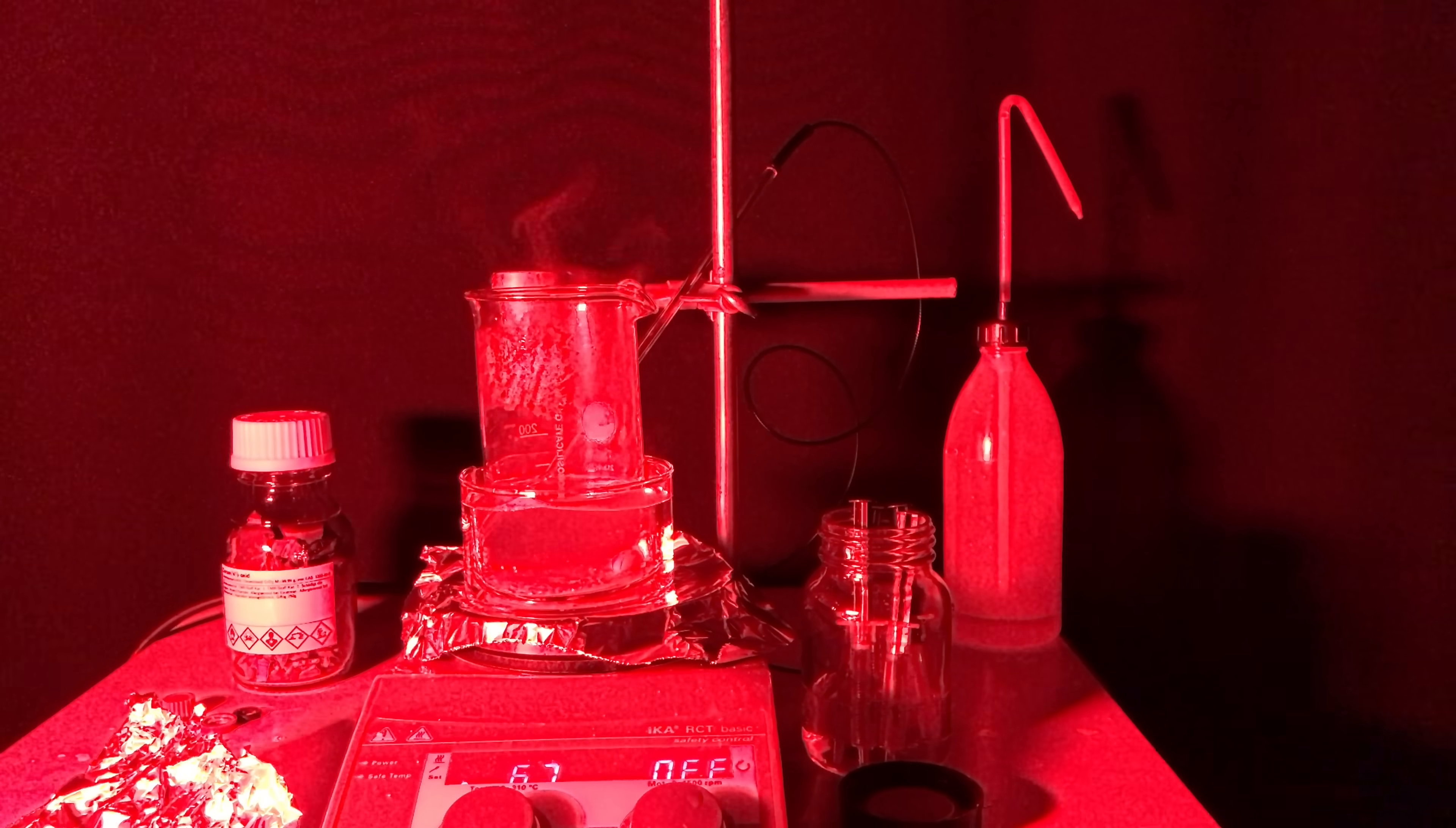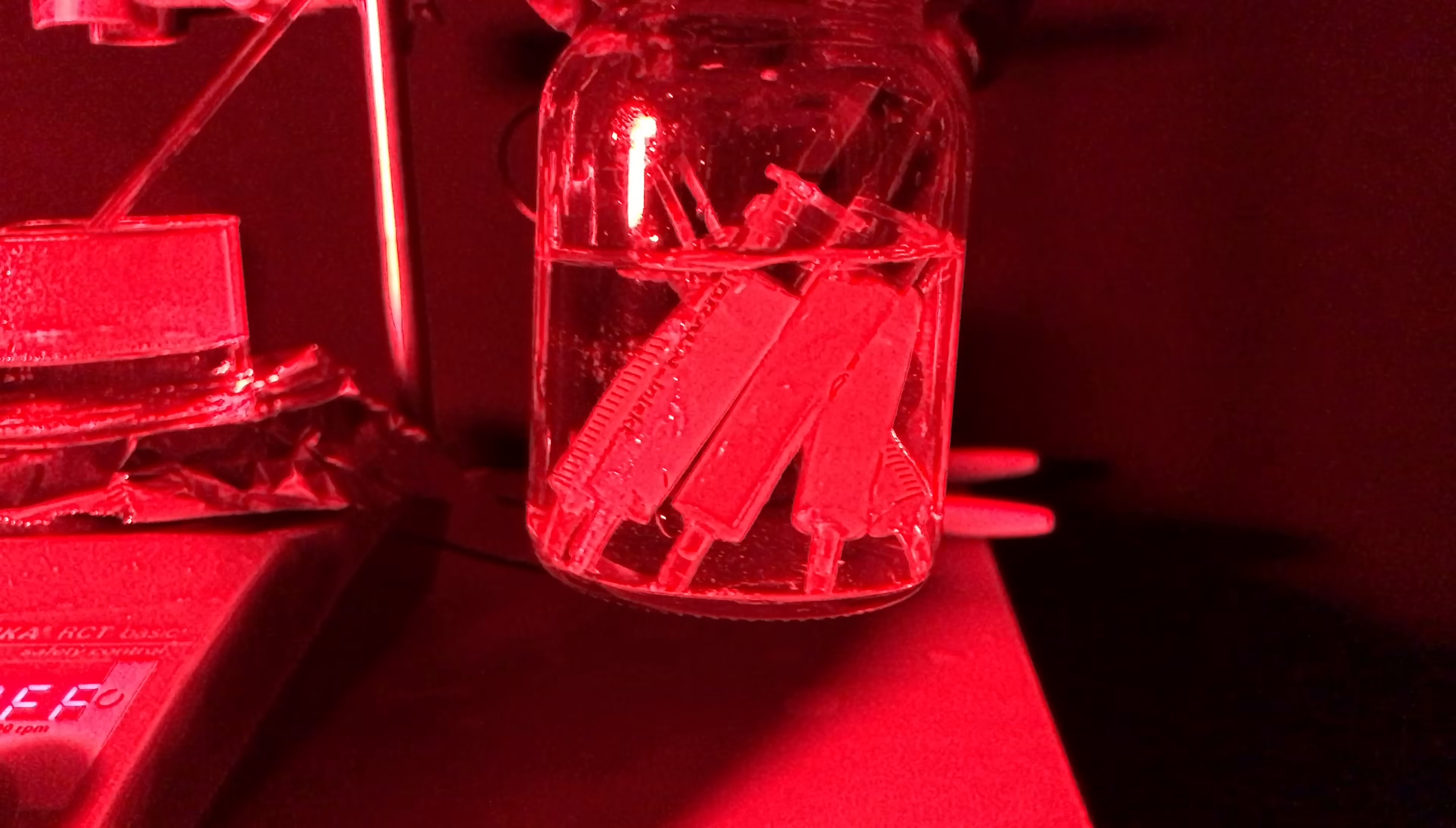As I did not want to continue today, the syringes were cut off, the glass was closed and put into a safe place.